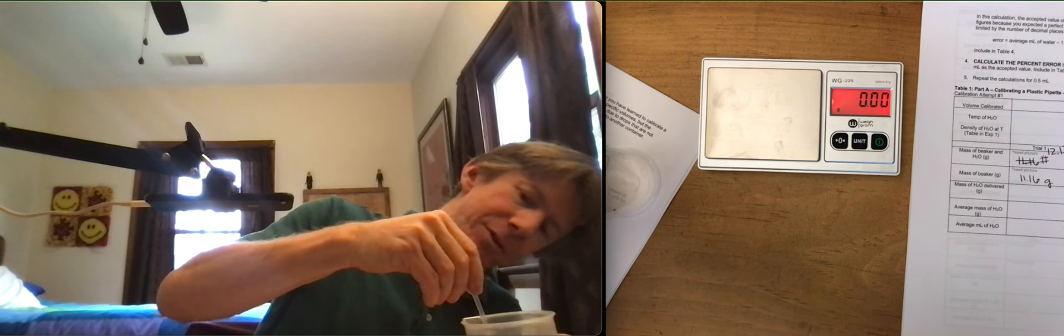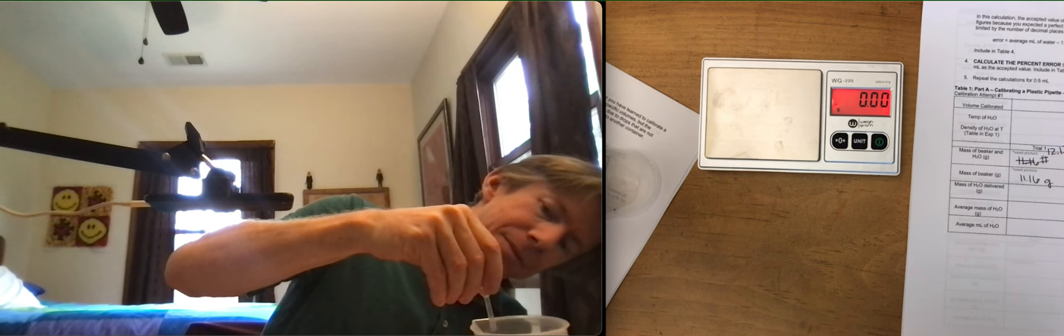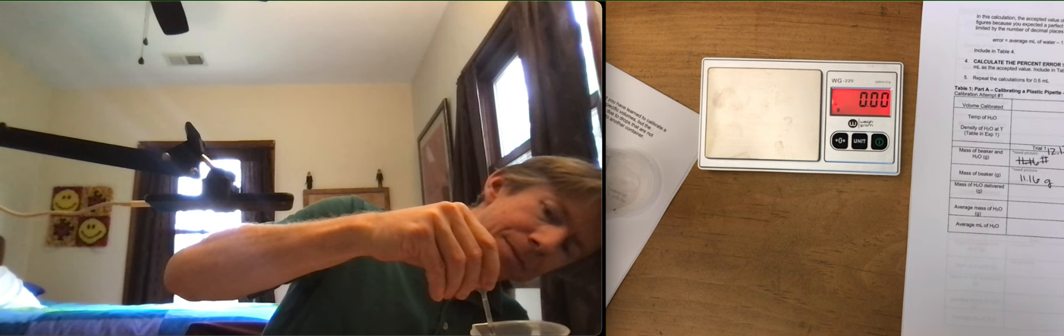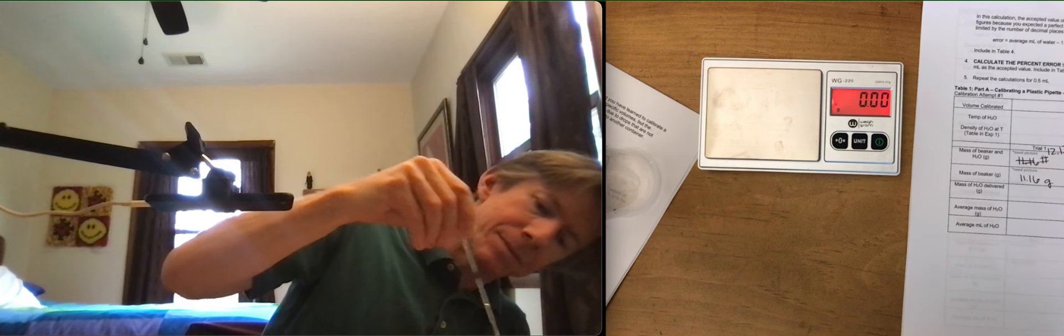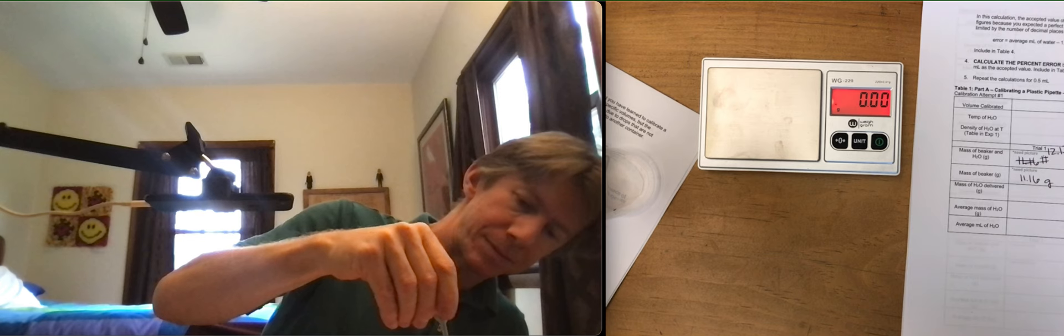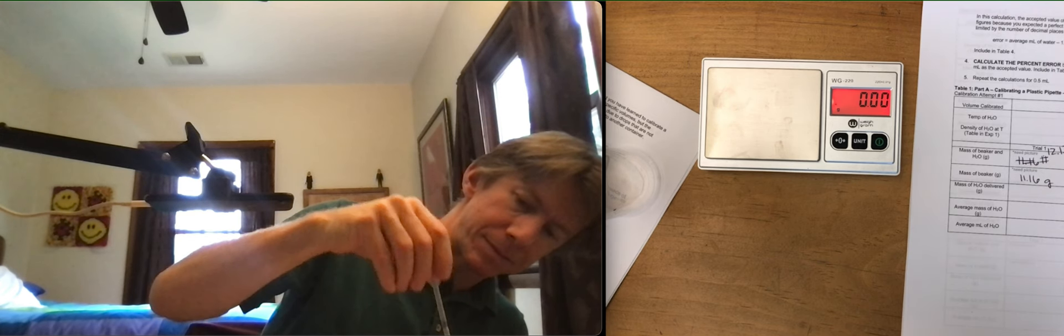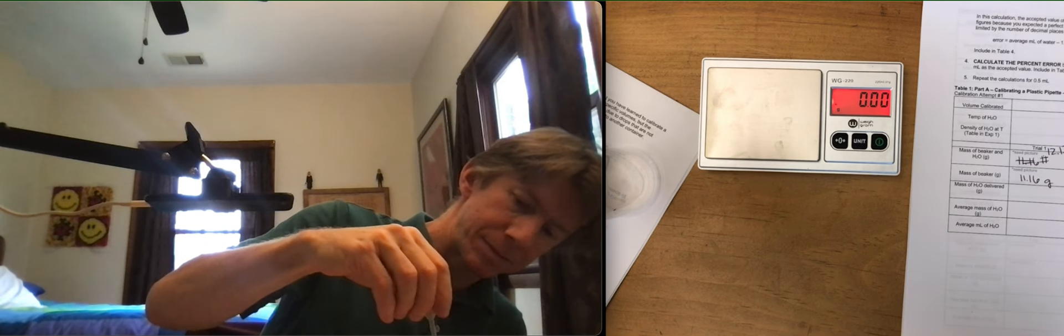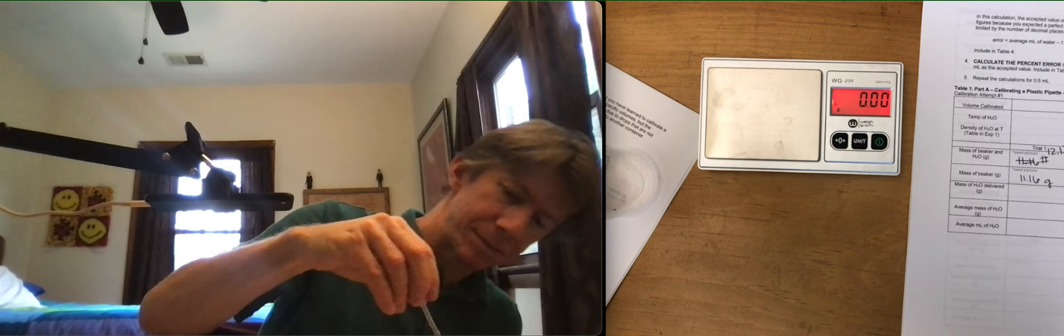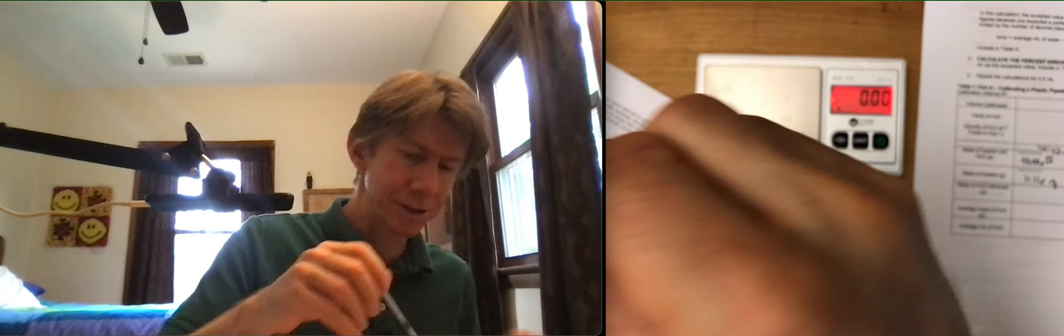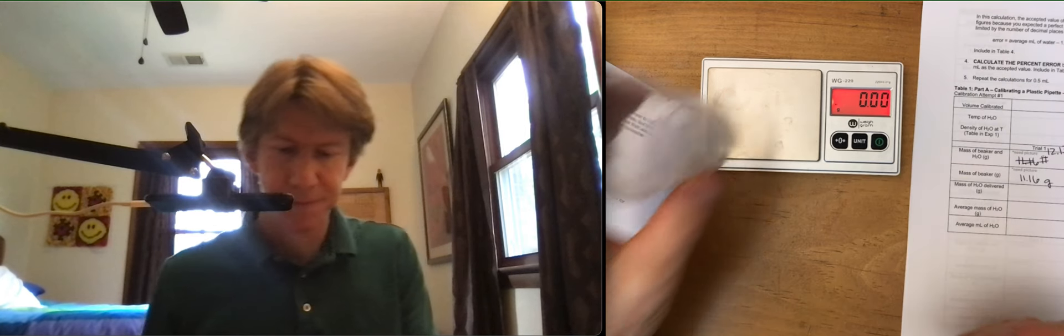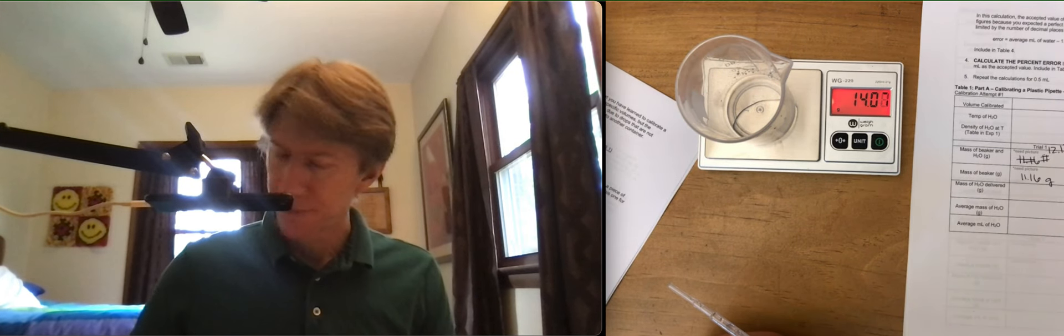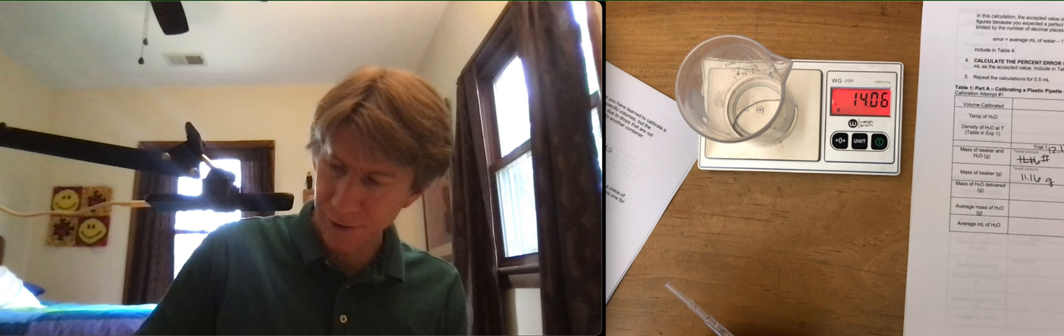I got some droplets stuck on there. There we go. And 14.06 grams. And each time, you're going to take a picture of this so that you can see the beaker, the water, and the display showing the grams, even as it changes.